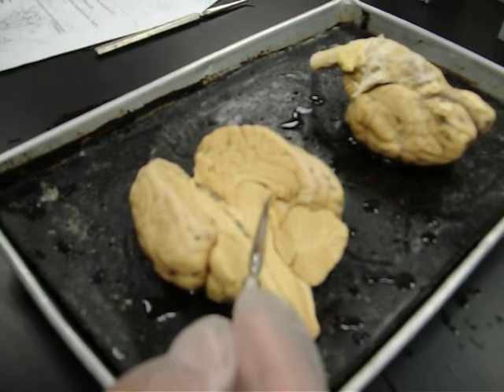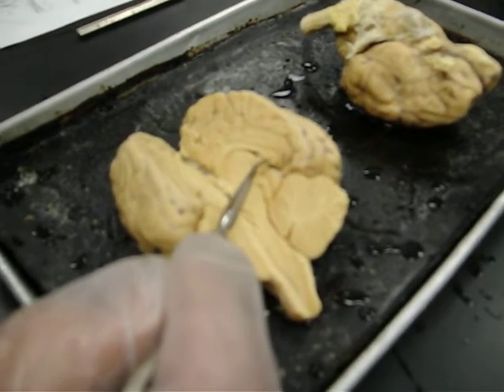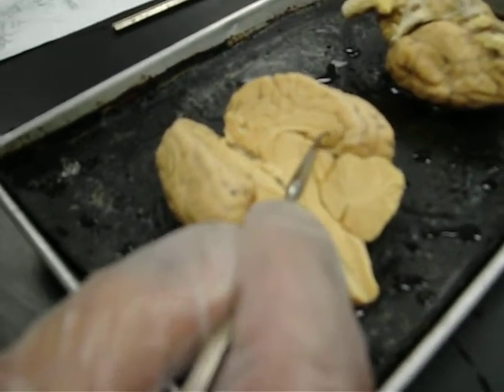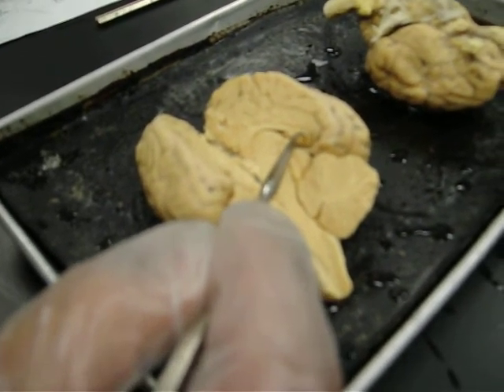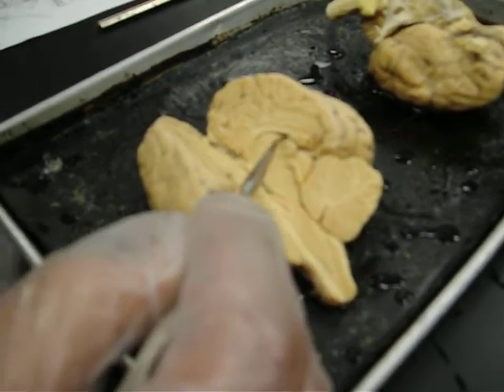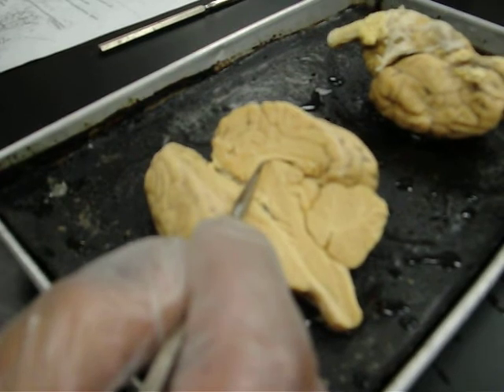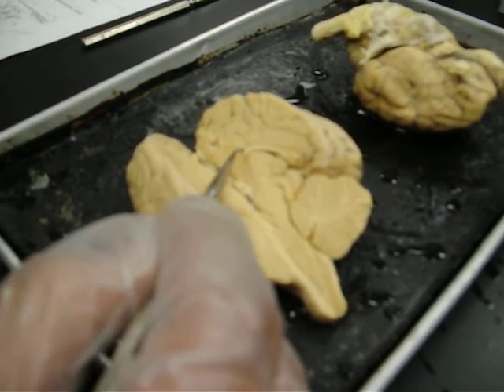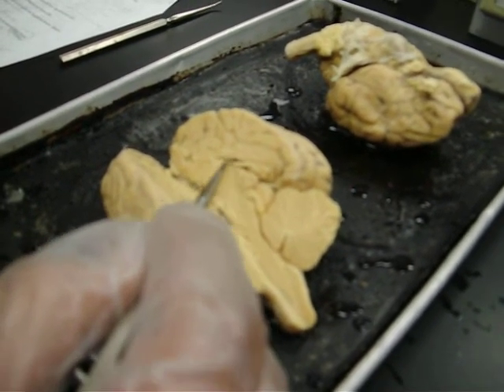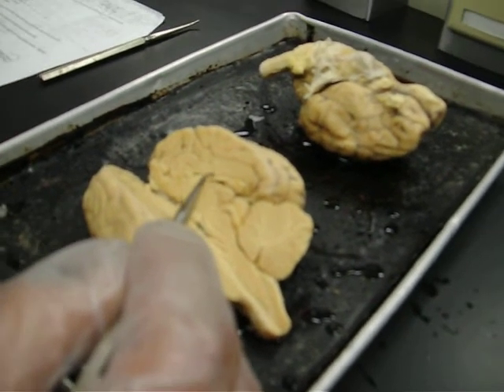And above that there is the pineal body, which is, I believe, this part right here, and the region kind of goes around the pineal body, and that is continuous with the third ventricle. Next to the third ventricle there is the fornix, which is this part, and on top of that there's the lateral ventricle.